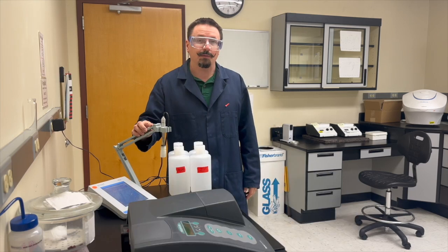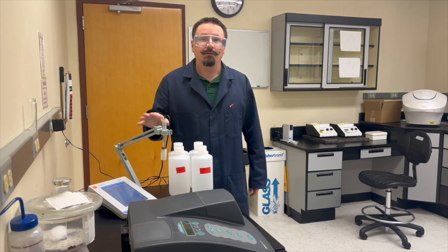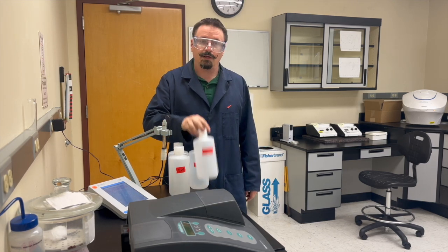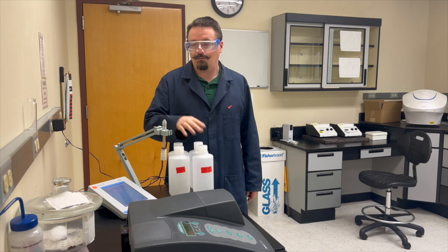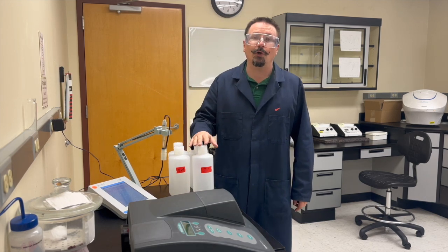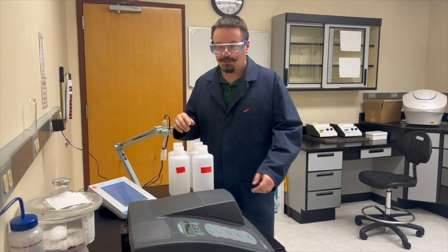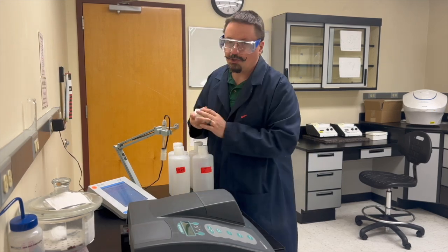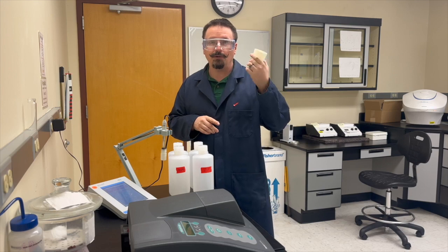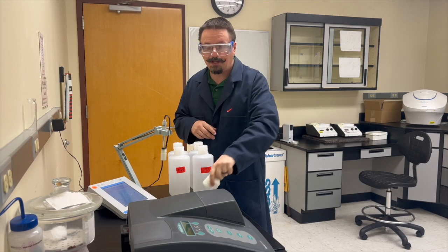You'll need to find the pH of your water. Take a small amount of the water you sampled, find the pH of that, and then you can reinstitute and reuse that water. After that, you're going to need to filter the water for non-dissolved species. You're going to use your Buchner funnel again and do a vacuum filtration like you did previously for the gravimetric analysis.